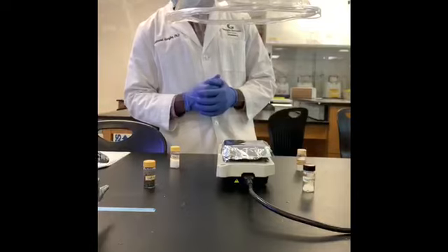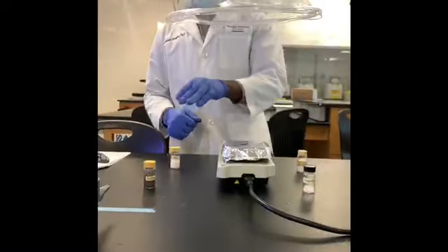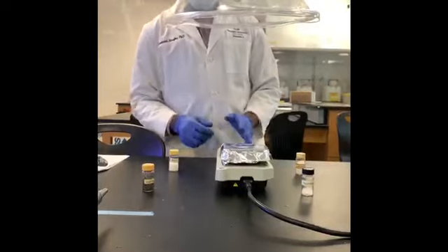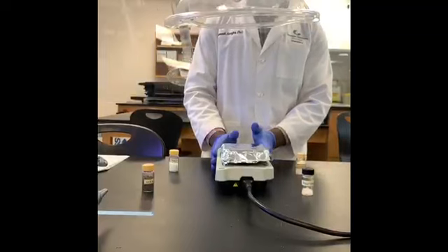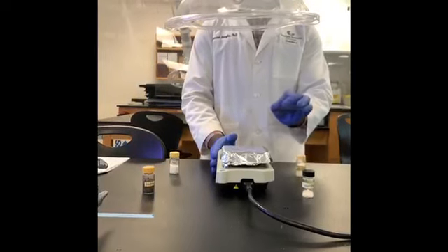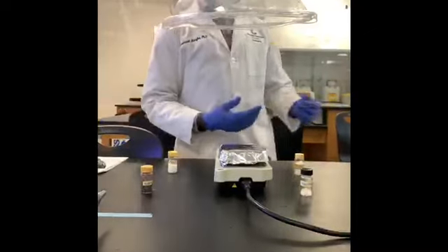So what do we have? We have naphthalene, we have iodine, we have sucrose, and we have sodium chloride. I have covered the top of a hot plate with aluminum foil. I will place a small amount of each sample. Make sure I know which position is which sample so that I can track that.